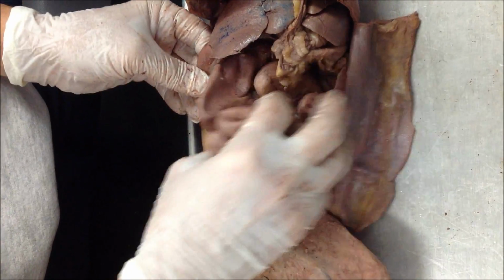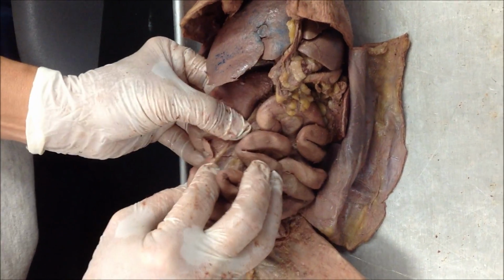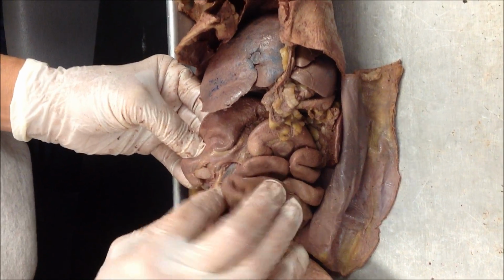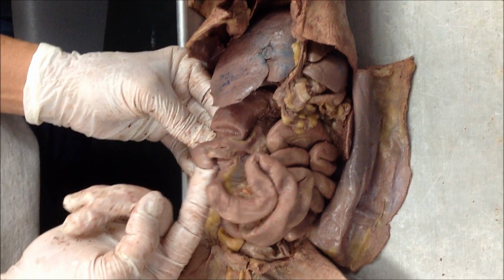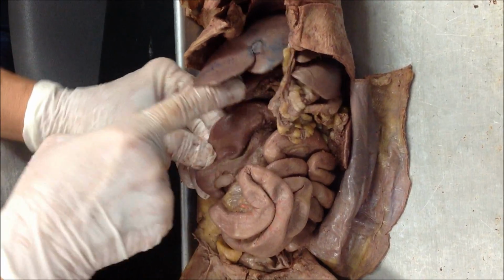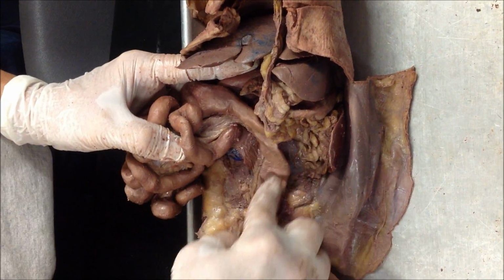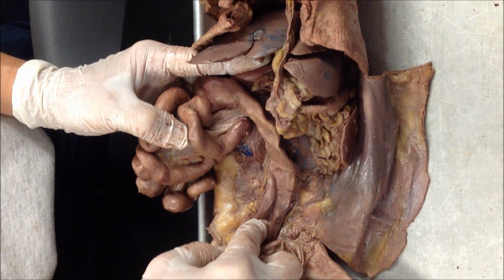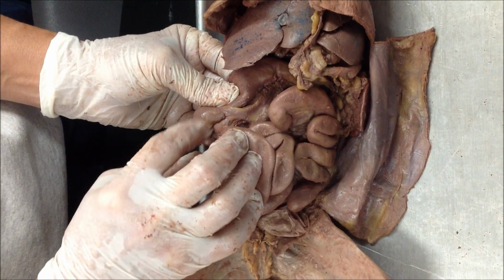The only place that you can find ileum is when you get all the way back to the large intestine. When you hit the large intestine, you know that it goes ileocecal valve, which is going to be that little ridge right there. So this has got to be ileum. This is going to be your large intestine. So this is cecum, ascending colon, transverse colon, descending colon. Remember, the cat doesn't have a sigmoid colon. And then when you look right there, that's going to be a lymph node.